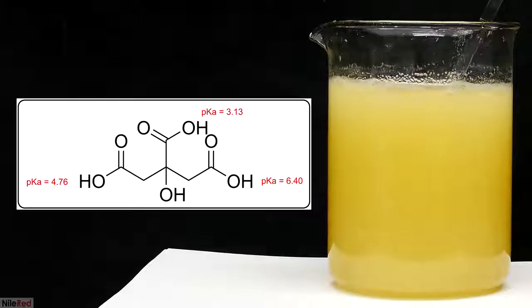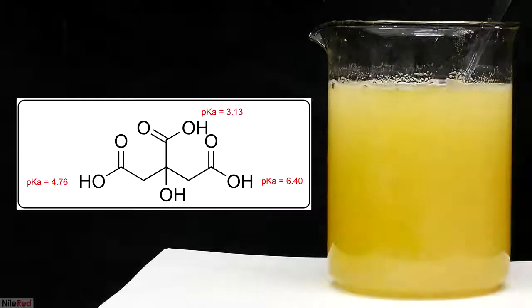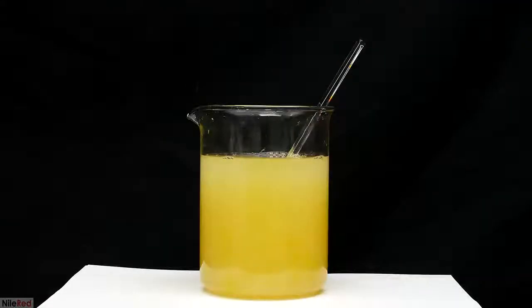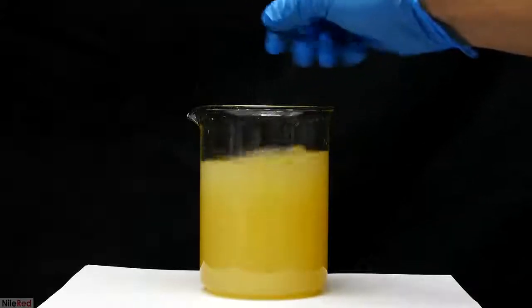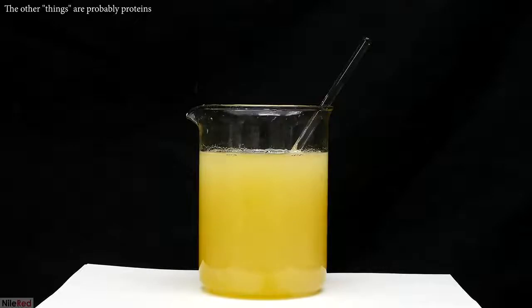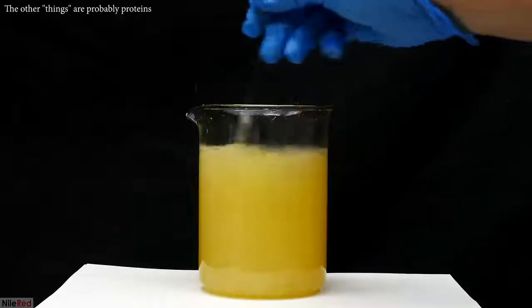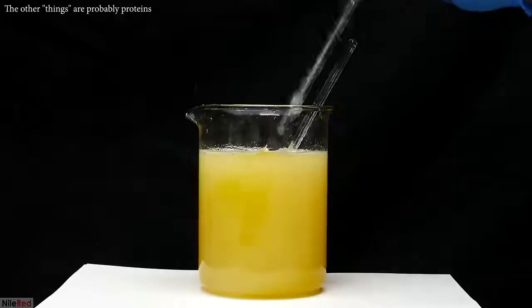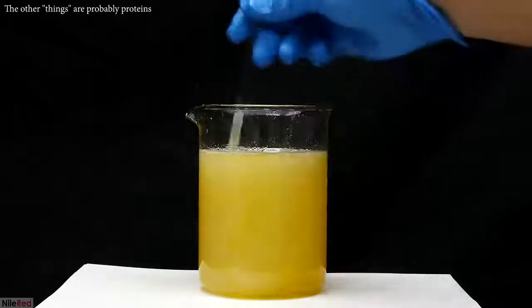For the second most acidic proton, we'll need a pH around 7, and for the least acidic one, we need to bring it up to about 8.5 or 9. Once we get a pH of about 9, almost 100% of the citric acid should be neutralized. As the pH increases, the solubility of other things will decrease. This will cause a lot of them to precipitate out, and as we continue to add sodium hydroxide, more and more solid will form.